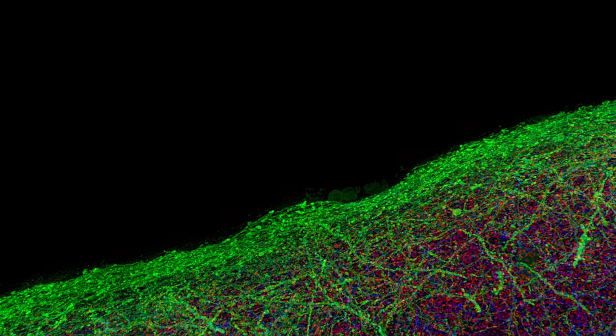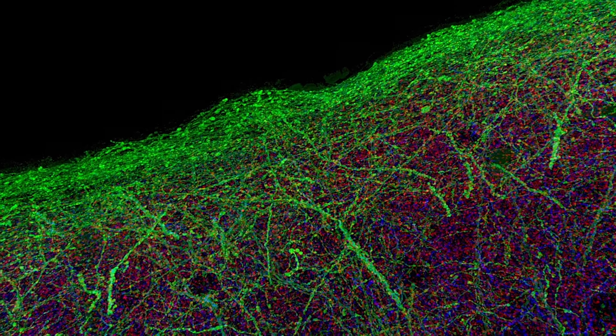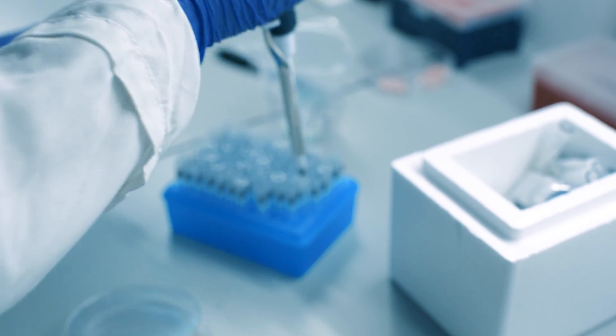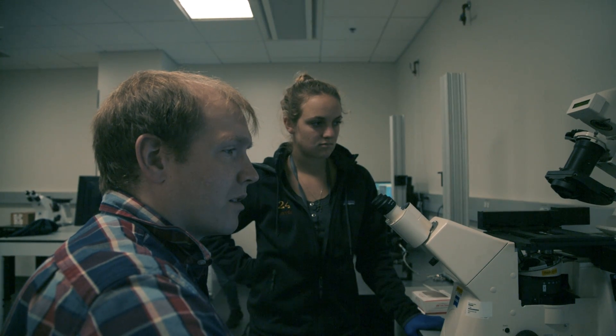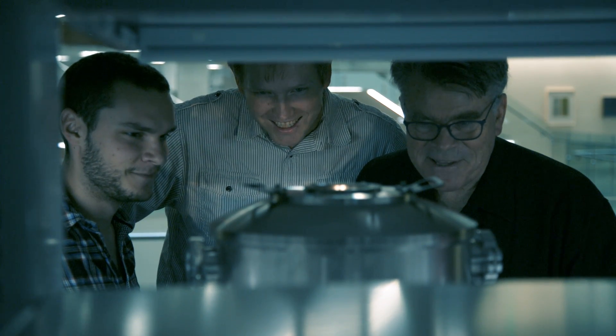The beauty in array tomography is not so much in the method — it's in the brain itself. We tend to think nature is beautiful, the starry sky is beautiful, so maybe we shouldn't be too surprised that the insides of our brain are beautiful too. I can't do the tissue prep and chemistry that Linnea and her team can do, I can't do the sectioning the way she can, but I can build a microscope, program, and automate this procedure. Without each member of the team doing their specific and very different process, it can't work at the level we want to do it here at the Institute.